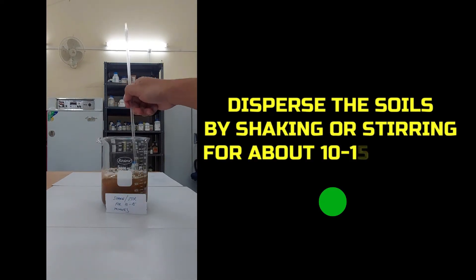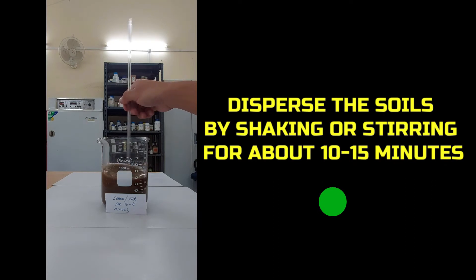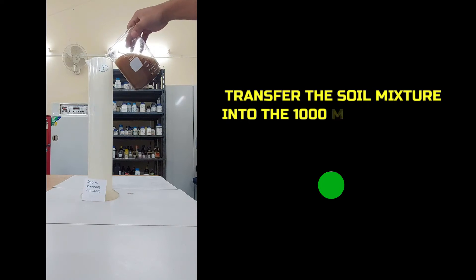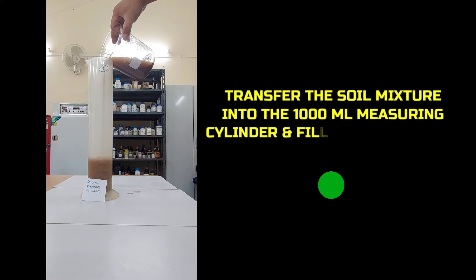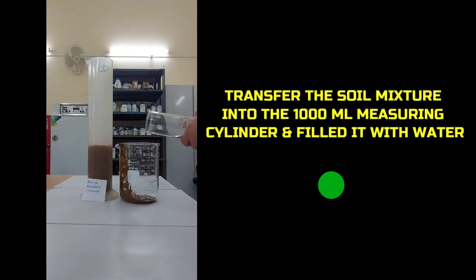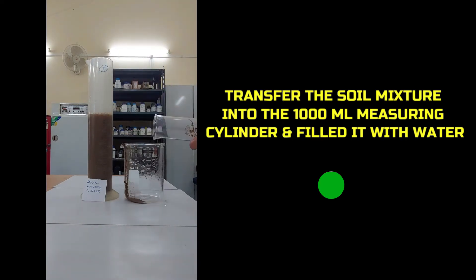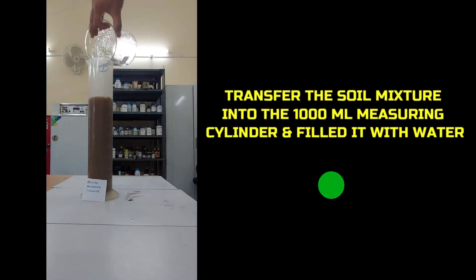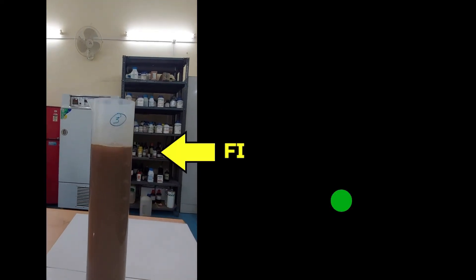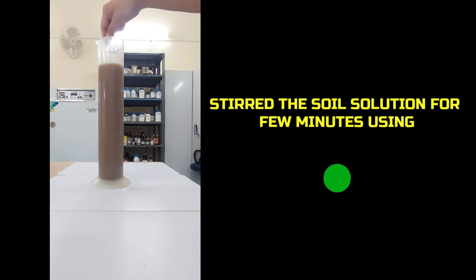Next, disperse the soil by shaking or stirring for about 10 to 15 minutes. Then transfer the soil mixture into the 1000 ml measuring cylinder and fill the cylinder with water up to the mark. Next, stir this soil solution for a few minutes using a glass rod.